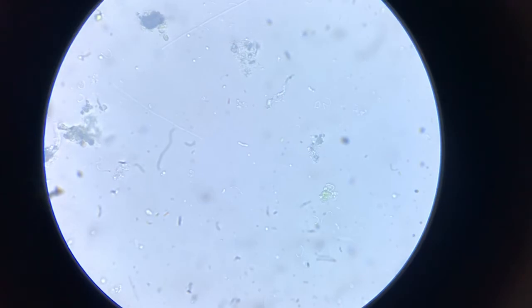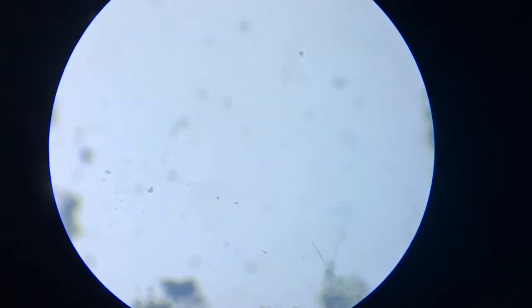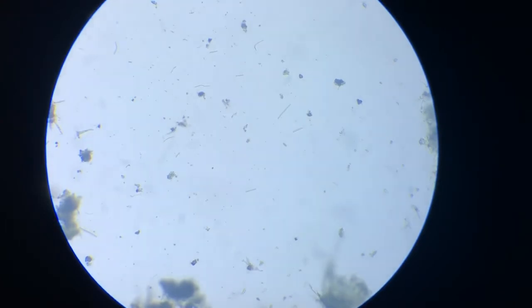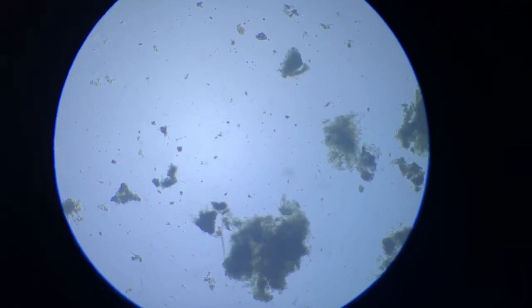Now it is at 400 times magnification, and I'll move to 100 times magnification. This is 100 times magnified, and we don't see any hint of that worm now. There is no hint of that worm, and now I go for lower magnification at 40x, and this is what we see. So you can make out the size of this organism. We don't get any clue about it now.